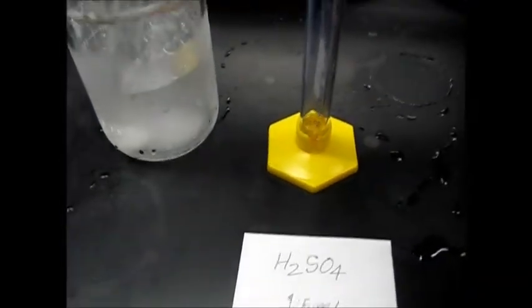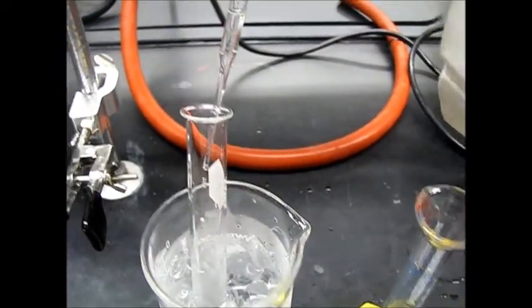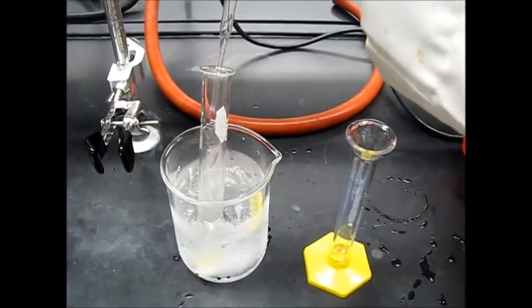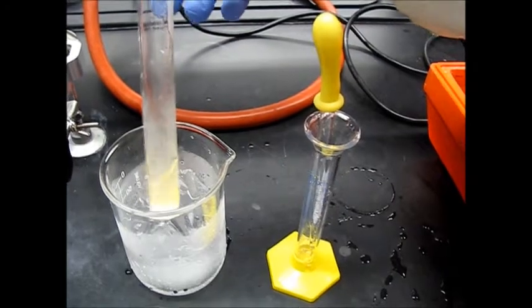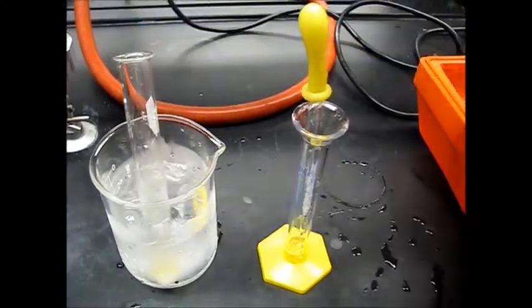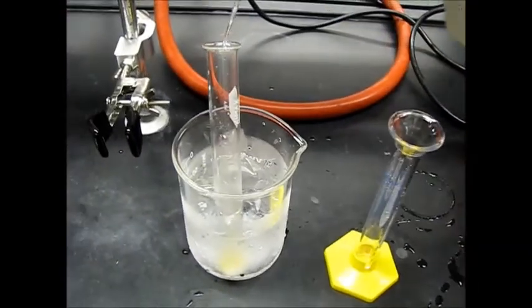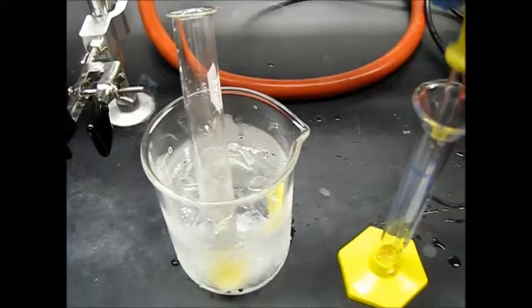Next thing, after cooling for a few minutes, we will add dropwise. So here add very gently, very carefully, sulfuric acid into your reaction mixture dropwise. And as you add, you can see this color change, so you can just gently mix it like this, and then keep it in the ice so that it remains cold, otherwise this is an exothermic reaction. Here you can see it start fuming.